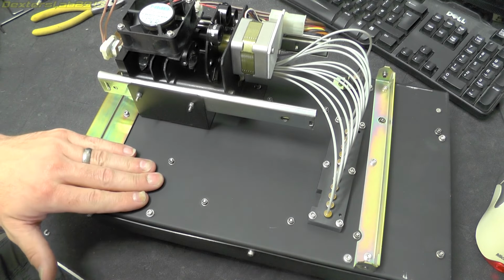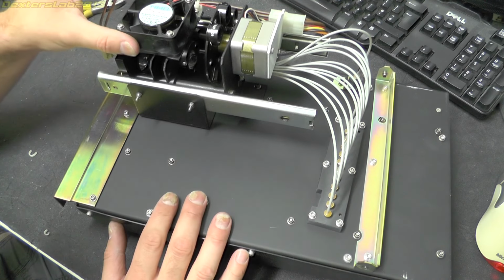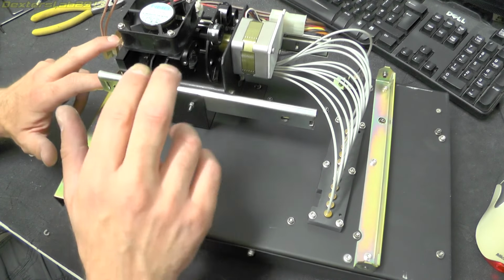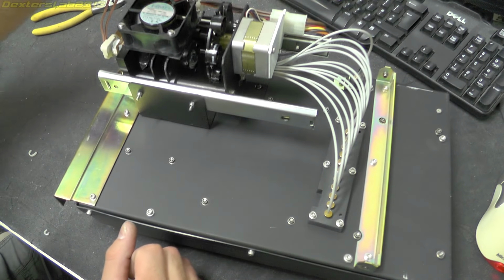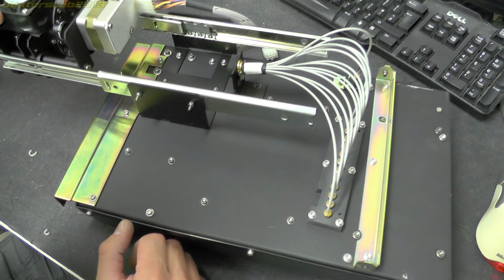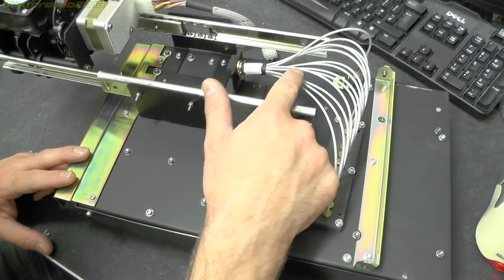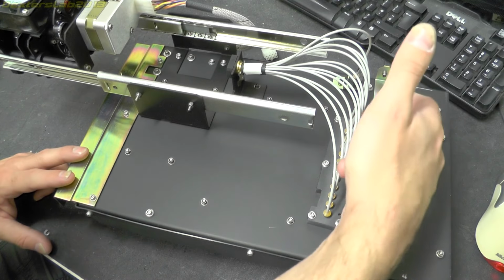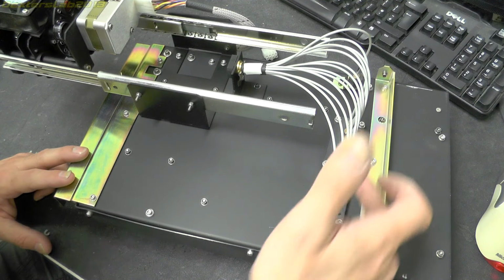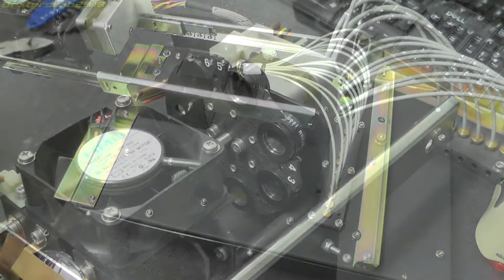We've got a metal chassis and a plastic cover which is on the underneath at the moment. We have the light source here on this section, which pulls out to allow you to change the light bulb, and the filters. So the filters are just running off this stepper motor, and it looks like the light passes through here onto this device here, and then we've got a number of wires which come over to what is quite clearly each of the lines of the microplate. I would imagine these are going to have to be optical fibers because it's certainly not going to be electric.